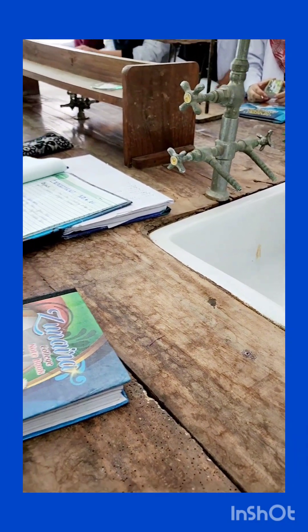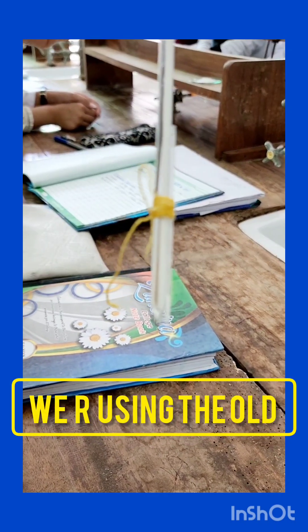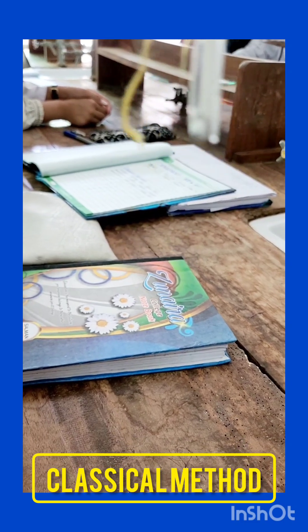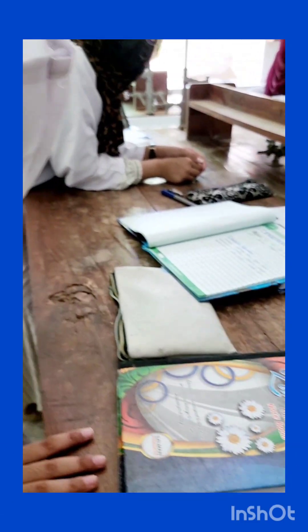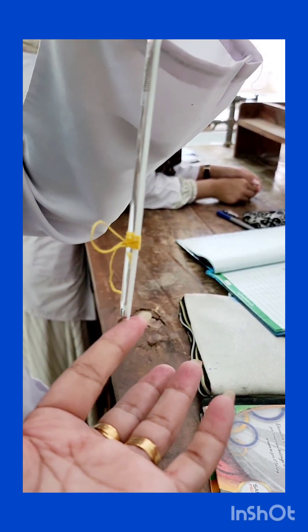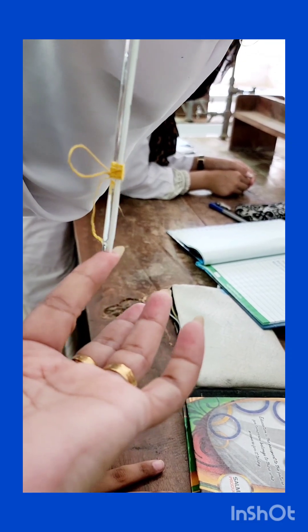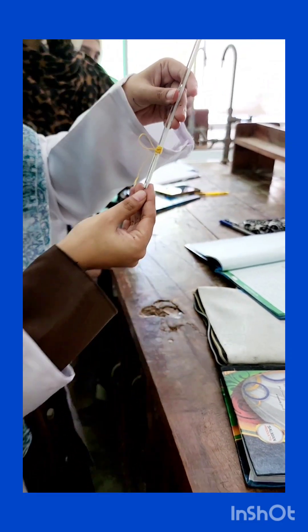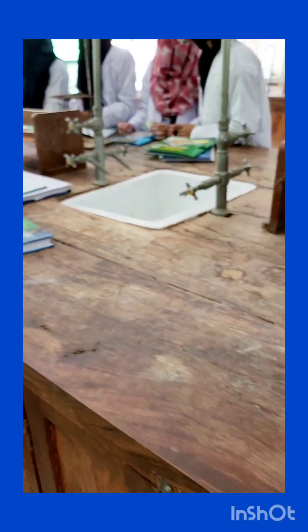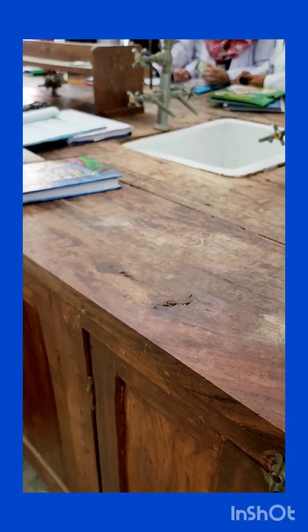The capillary tube is hanging a little bit below — it should be level with your thermometer bulb. The measurements and the capillary should be facing towards you, so that you can see the changes that are going to occur when you raise the temperature.